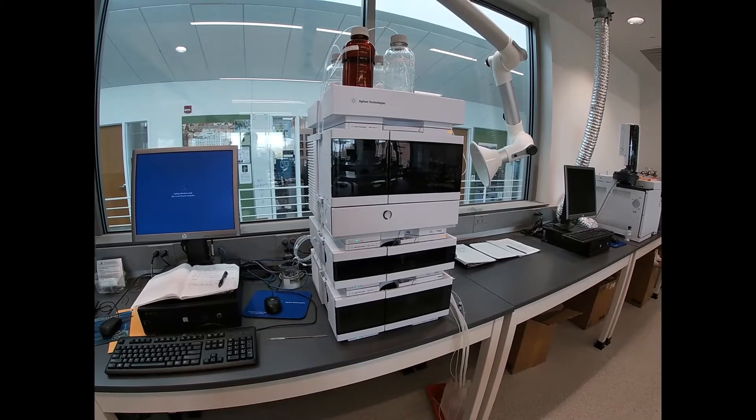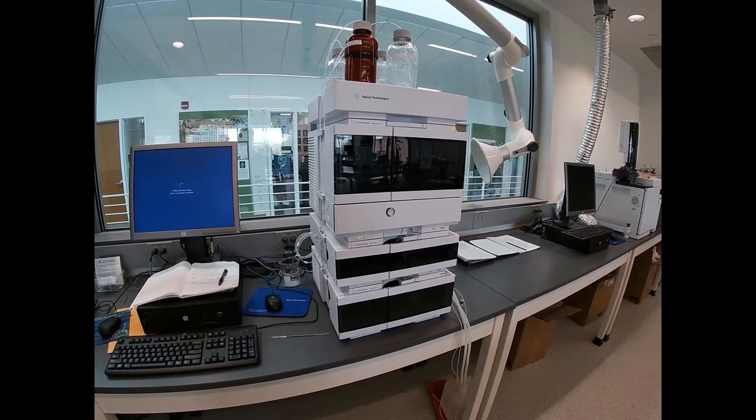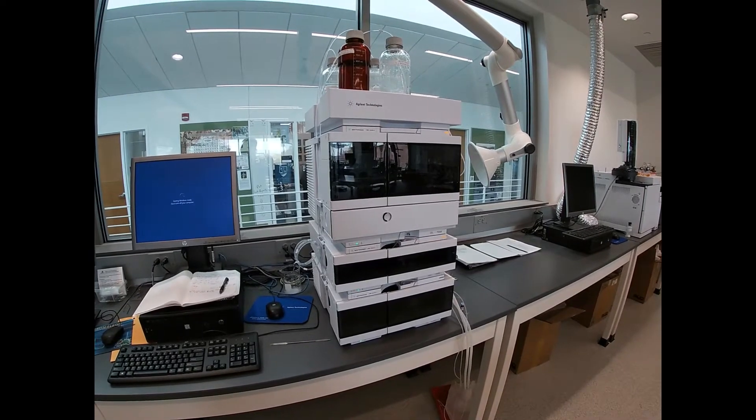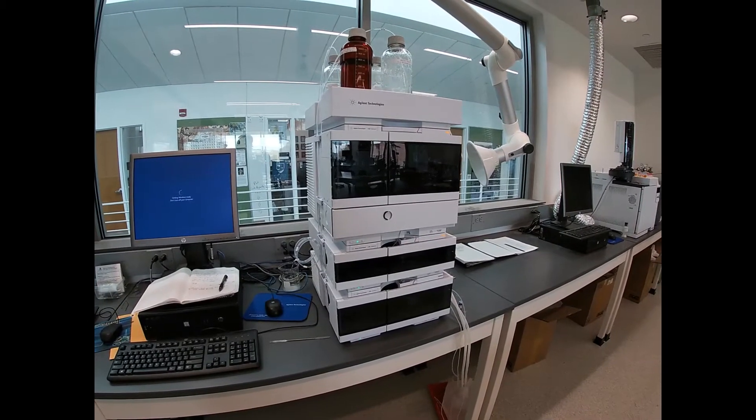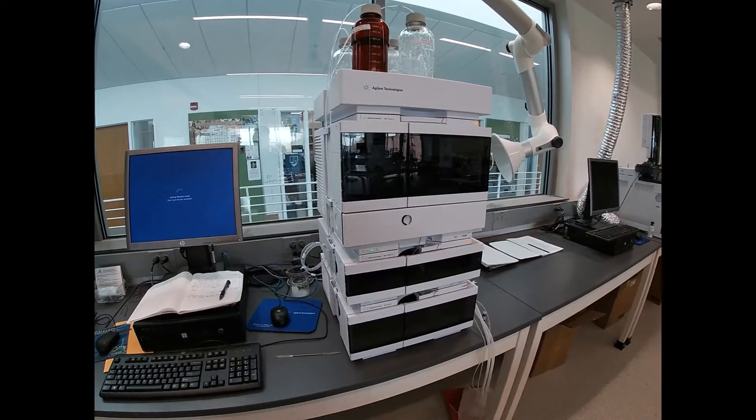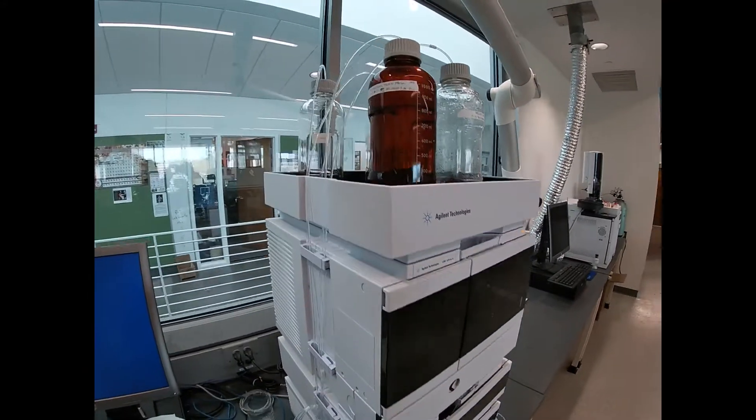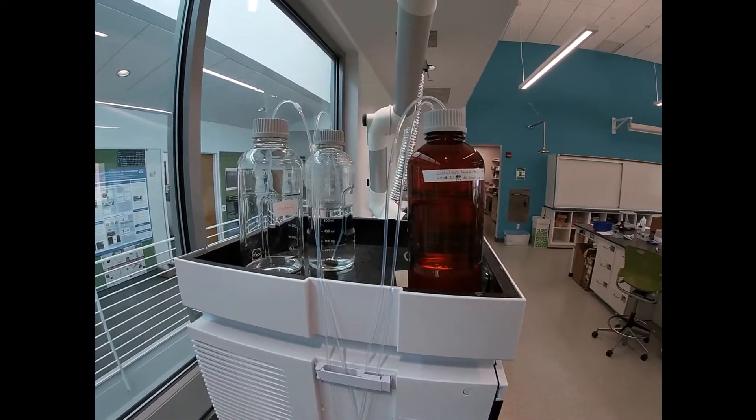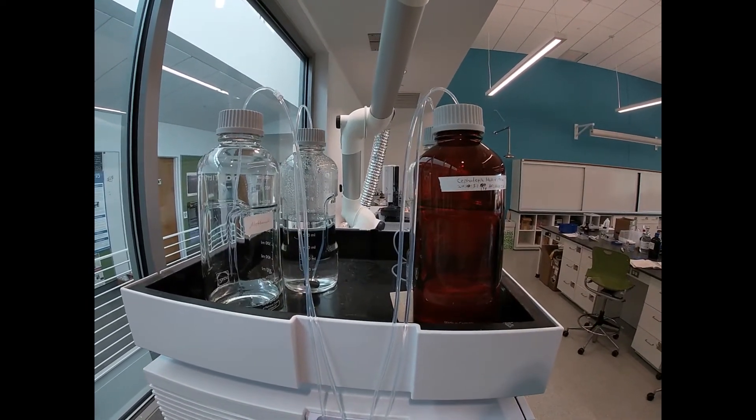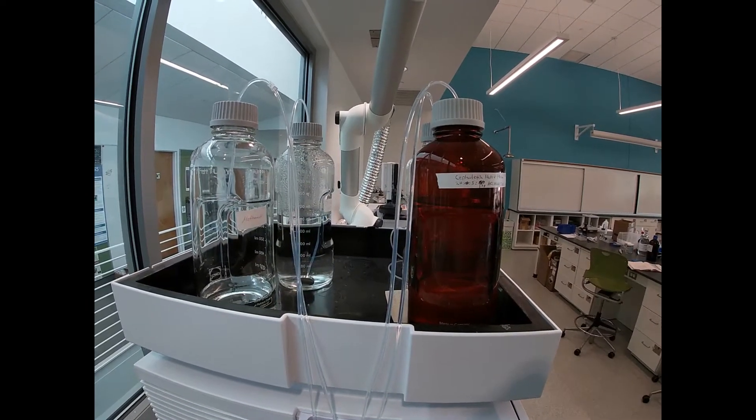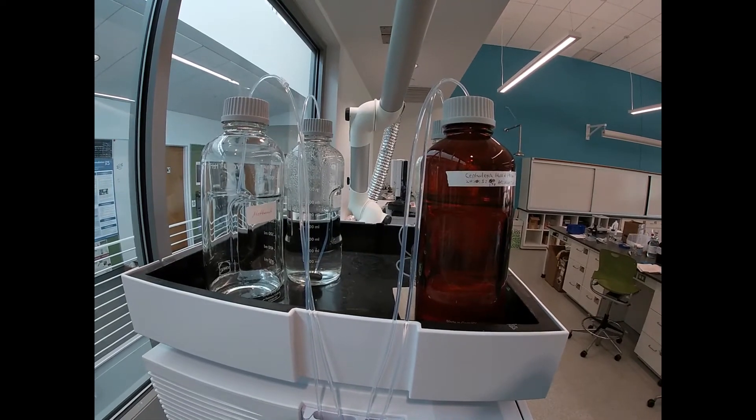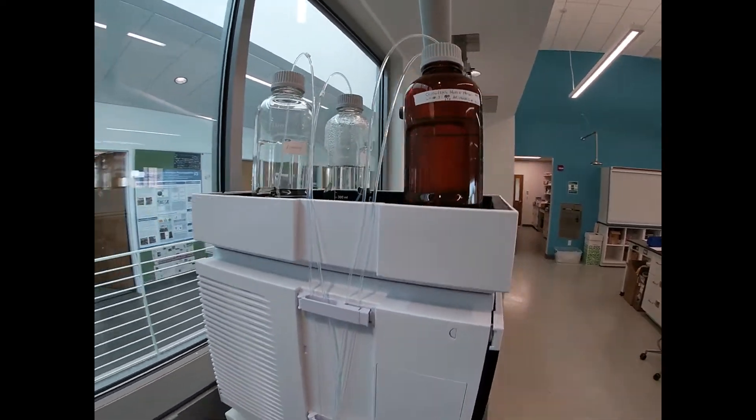This is your introduction to high performance liquid chromatography, HPLC. We have an Agilent Technologies 1260 Infinity 2 system. Up here you can see we have up to four different solvents we can use for mobile phase, and we can mix those proportionally.